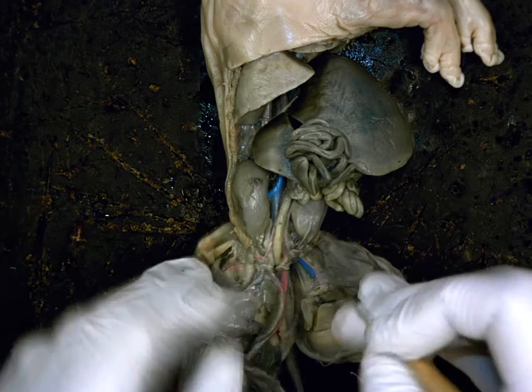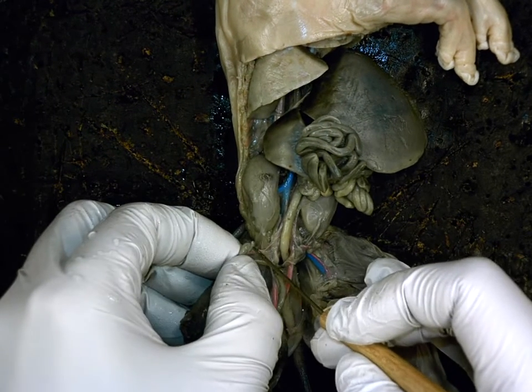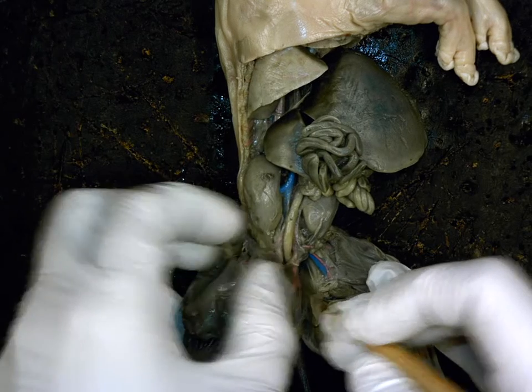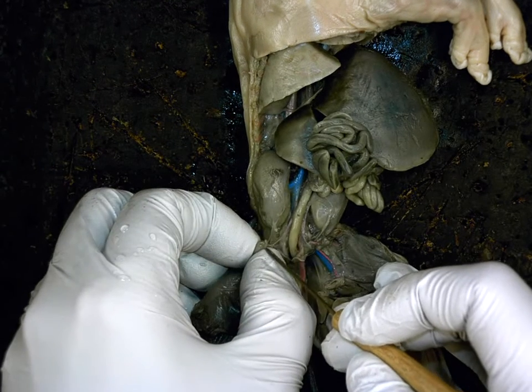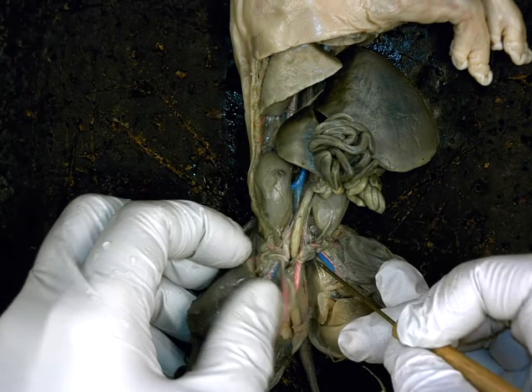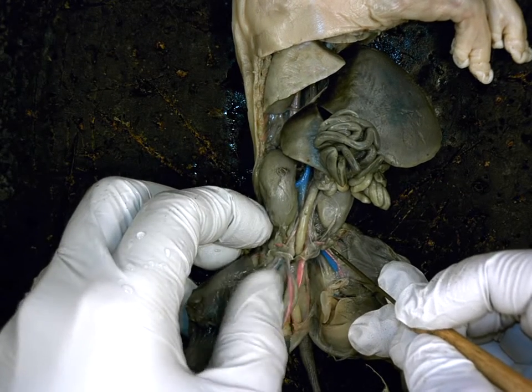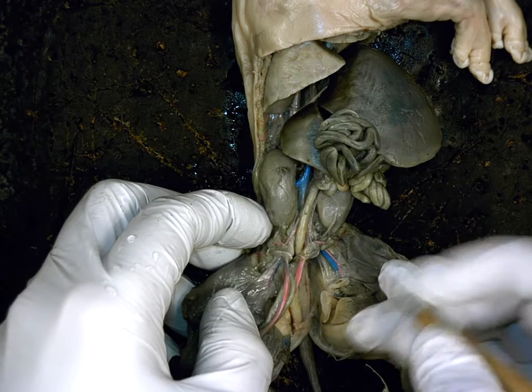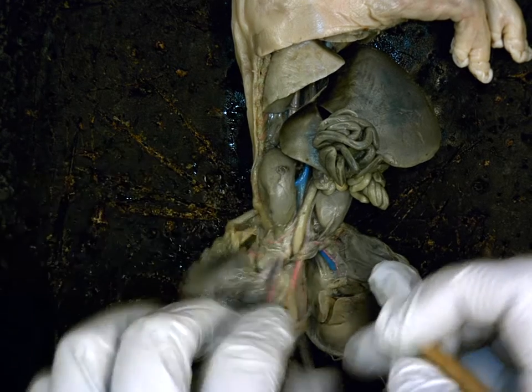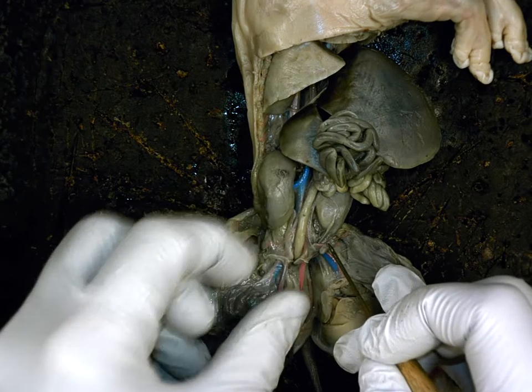Female hormones and eggs. From there, if you actually grab the ovary, you're going to see a tiny coiled up tube next to it, which is actually the what? Oviducts. Job of the oviduct: transport eggs and sperm. Both can actually swim through there, okay? Sperm and ova.